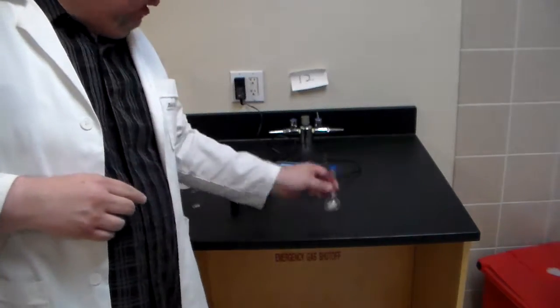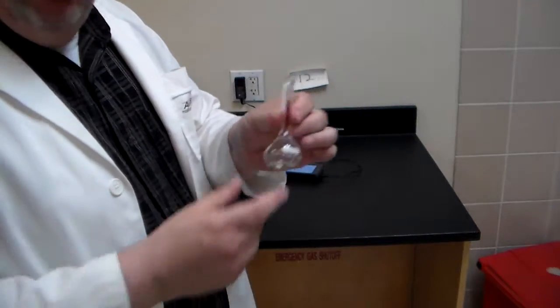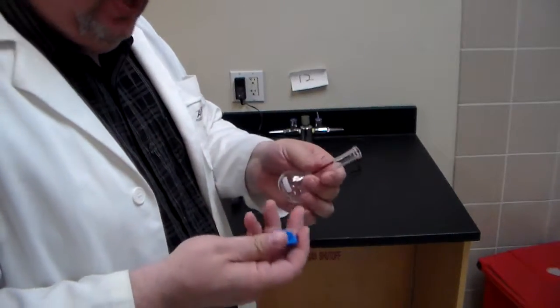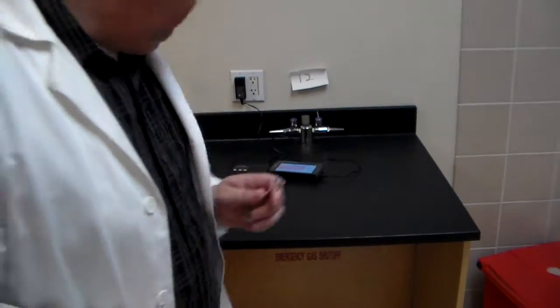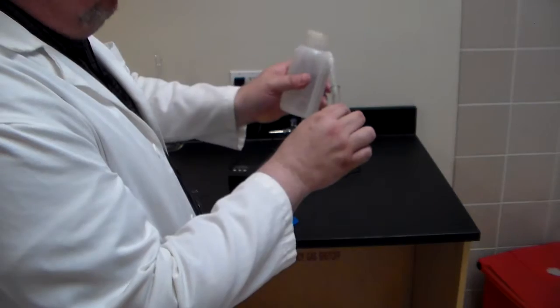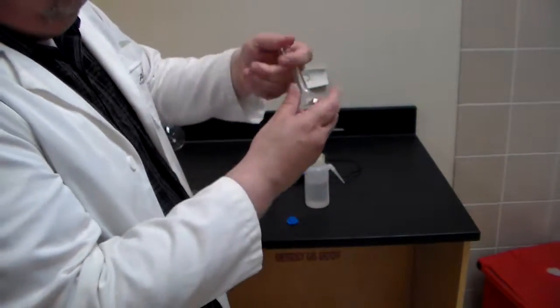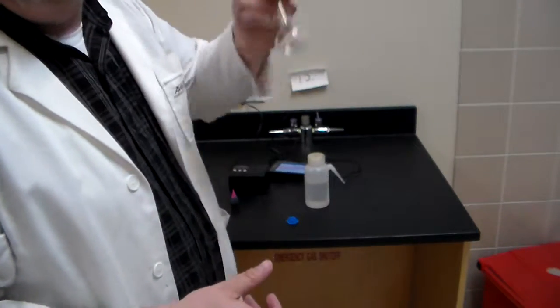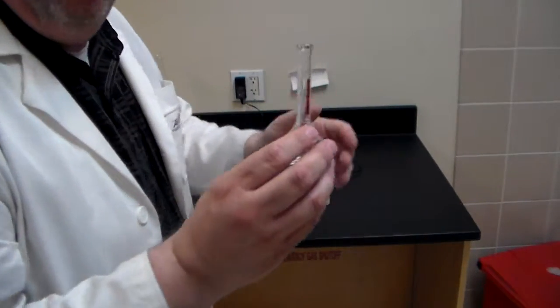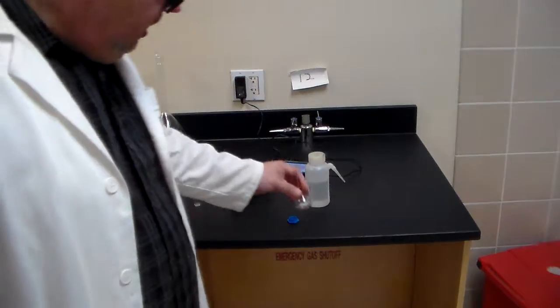What is that going to look like? Well, first, we have a volumetric flask, and we're going to make sure that it's rinsed out, that there's no dust in there. You can take the squeeze bottle here, and the idea is that we're rinsing it out. I'm just shaking it around to make sure if there's any dust or other unwanted particles, and then we're just going to dump it into the sink.